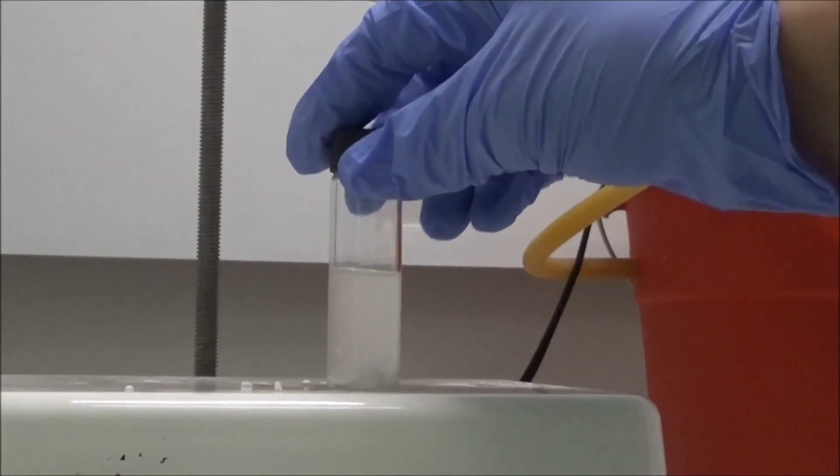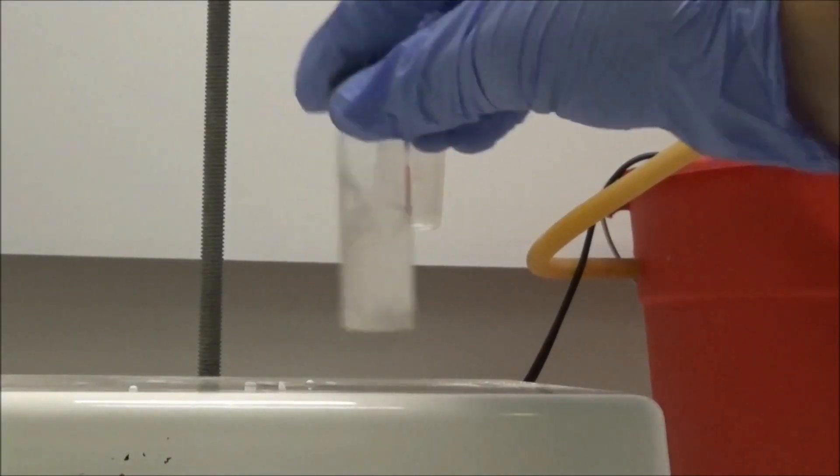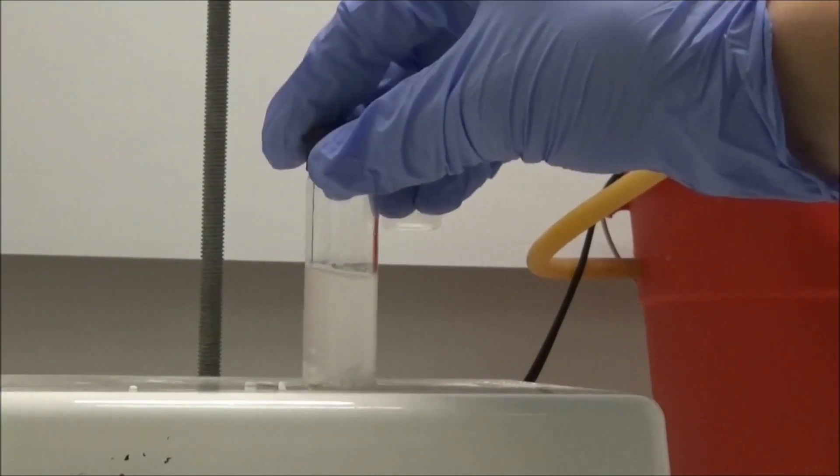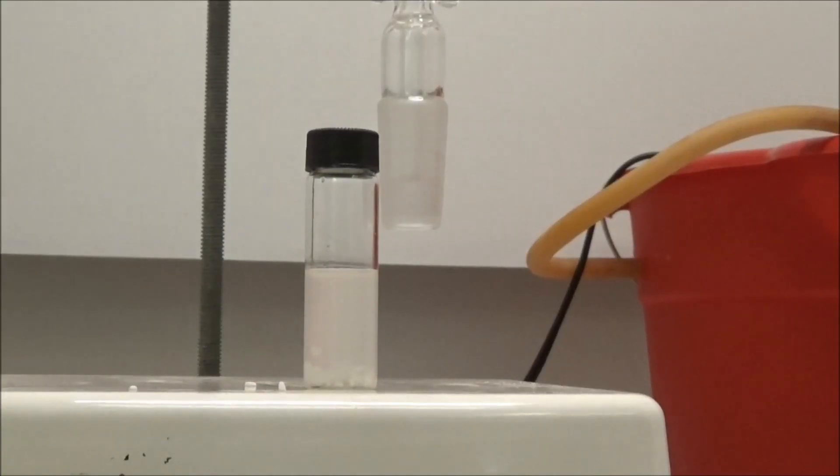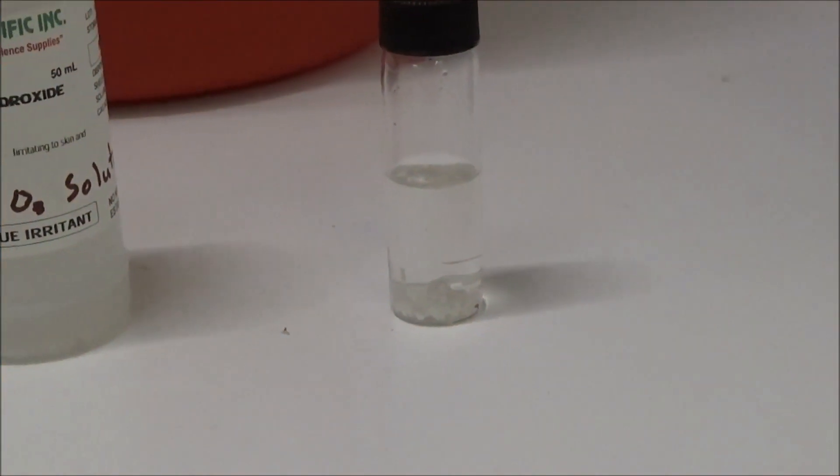Following the final washing, the cloudy bottom layer was transferred to a vial containing some calcium chloride to dry it. As you can see, after a few hours, it had cleared up completely.